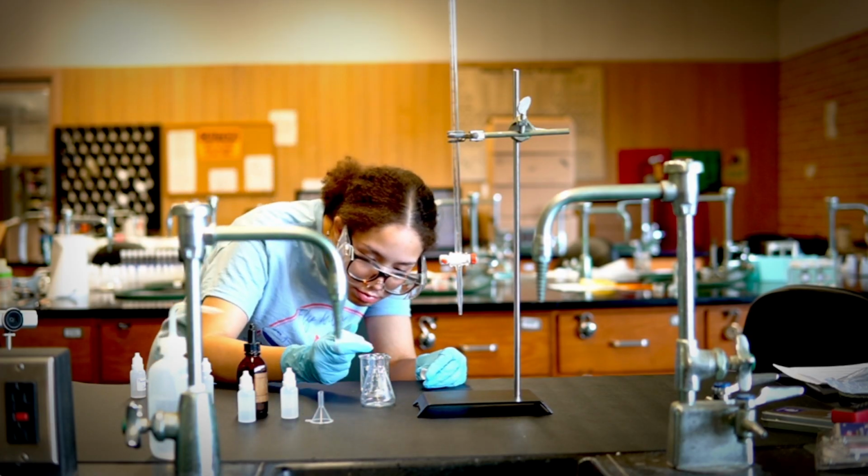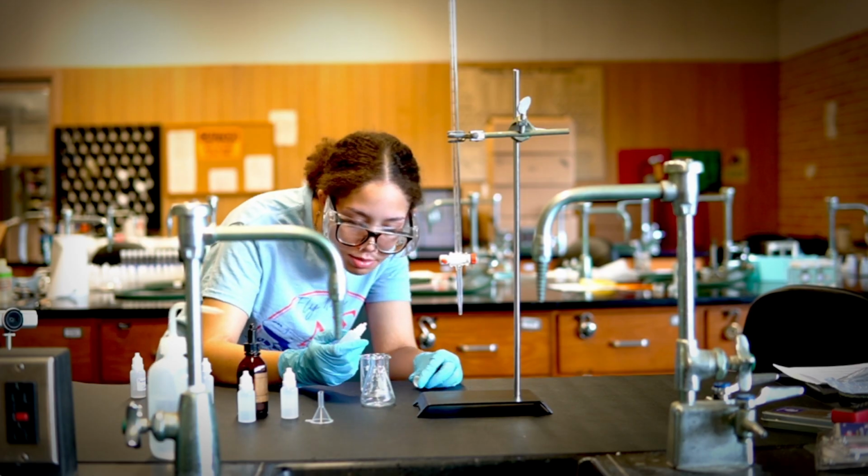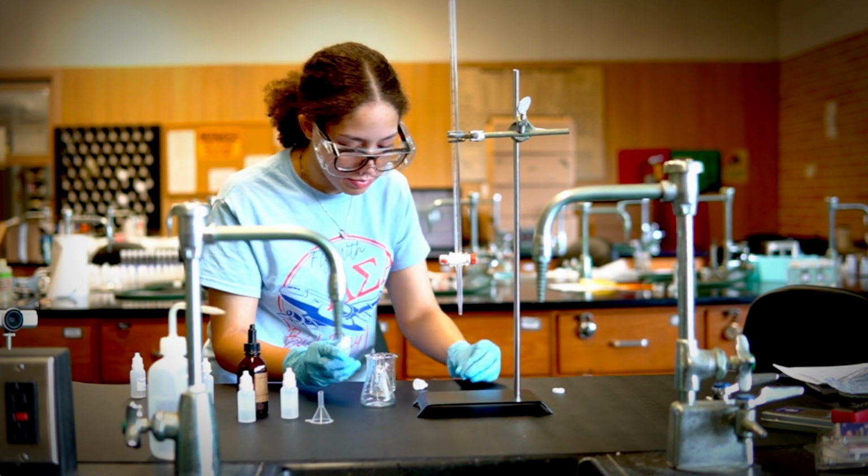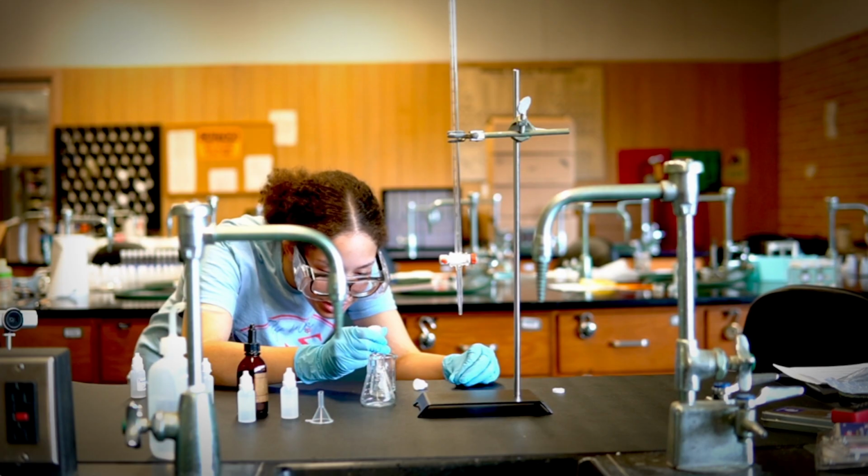So at first you're going to add your unknown acid into the flask, and then you're going to add an indicator. We're going to use an indicator in order to track the pH change. Because we're using a very small volume, add one drop, just one drop of your indicator, no more than that. One drop of your indicator, and then the volume specified of your HCl.